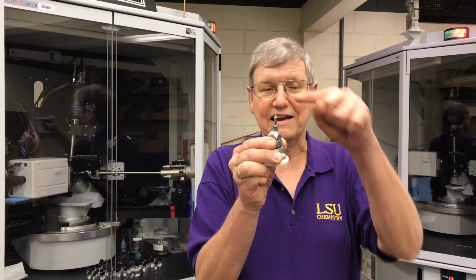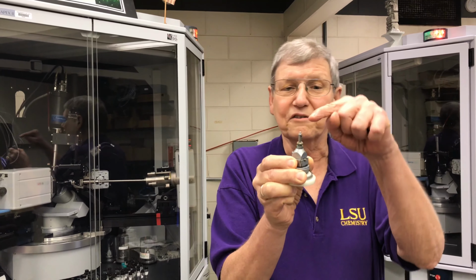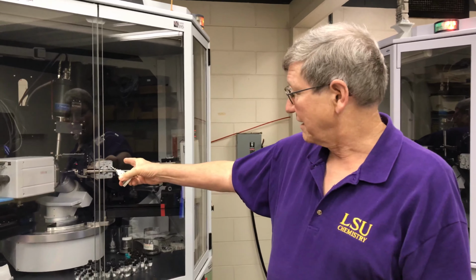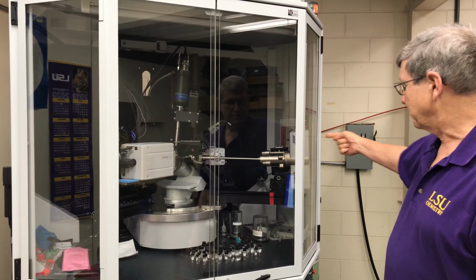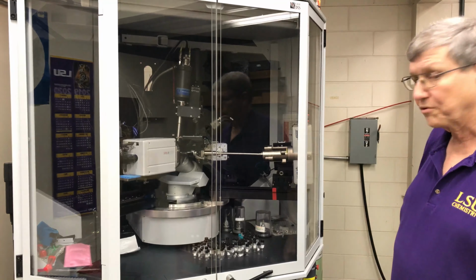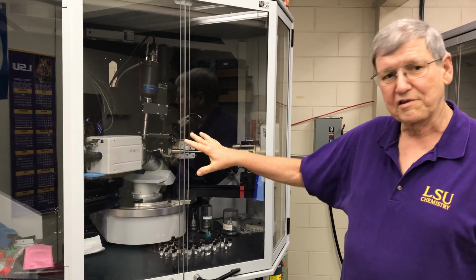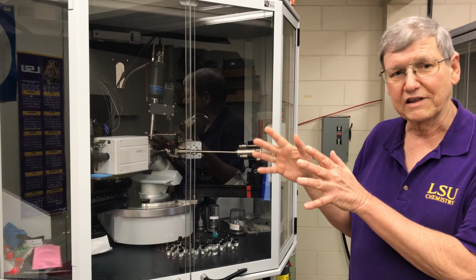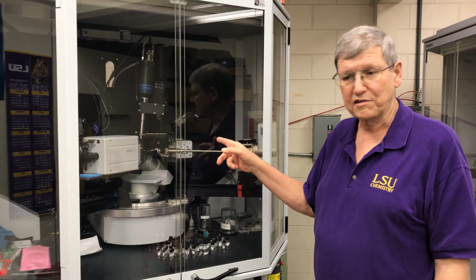What we do is we shoot X-rays at a very tiny crystal, about the size of a grain of salt or sugar or something like that. You can probably not see that one on the top of a little fiber here. But anyway, one of those is in the center of that instrument. We have an X-ray tube that shoots X-rays at the crystal. The X-rays are scattered into a diffraction pattern, and the main job of this instrument is to measure the diffraction pattern, the intensities of all the many tens of thousands of X-ray diffraction maxima that we get from that single crystal.